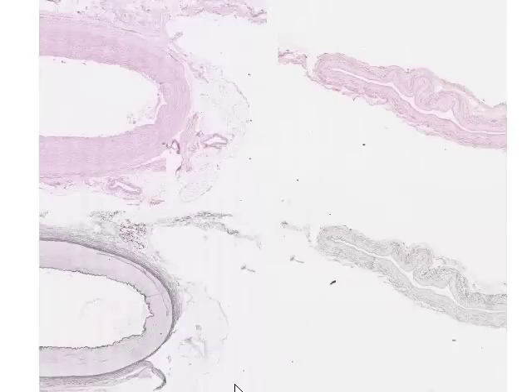Here's an interesting slide, because on this slide we have a medium-sized muscular artery, the vein which would accompany a medium-sized muscular artery, and in fact we have both of these sections shown here and here stained with hematoxylin and eosin, as you can see on the upper one, and then an equivalent identical section stained to demonstrate elastic fibers on the lower section. So let's begin first by looking at the hematoxylin and eosin stained muscular artery.